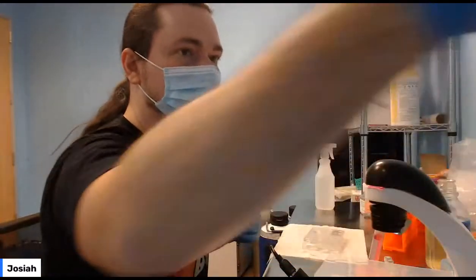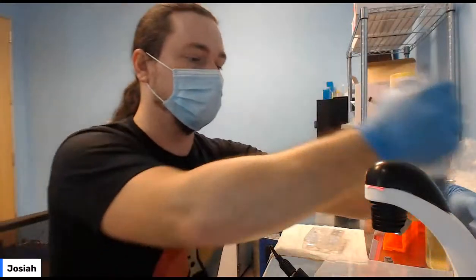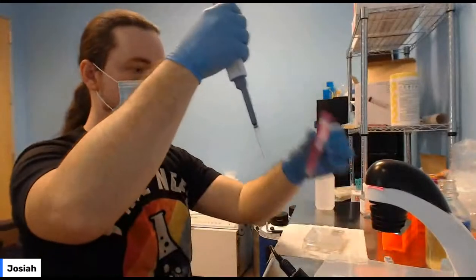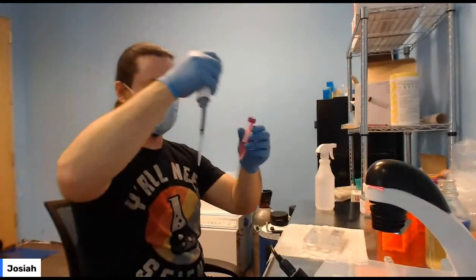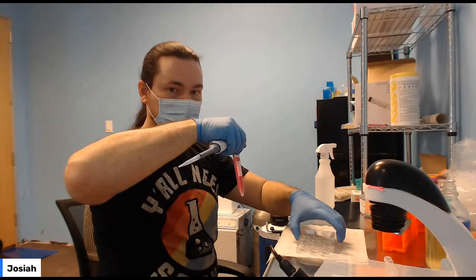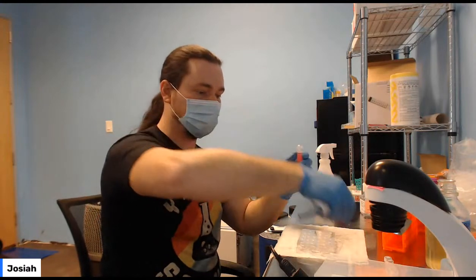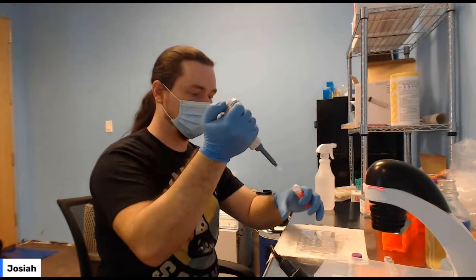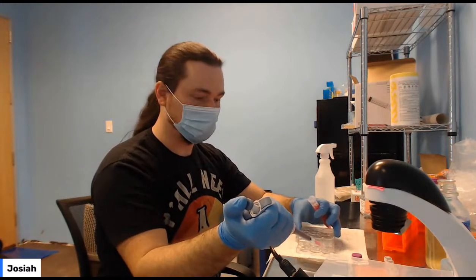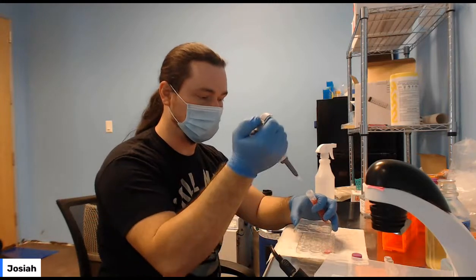Okay. You can take your 1 ml, 1,000 microliters, get your new tip, get your cells and media, and take this plate and set it in a good space where you can work. What I like to do is take an ml, lift the lid without really removing it, and put it in there.